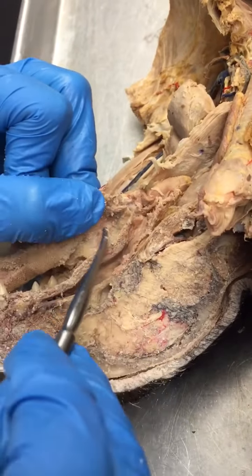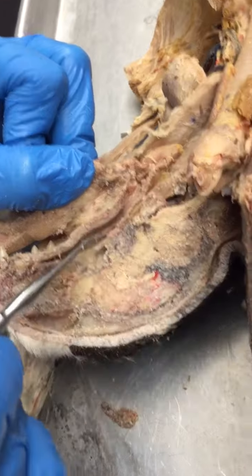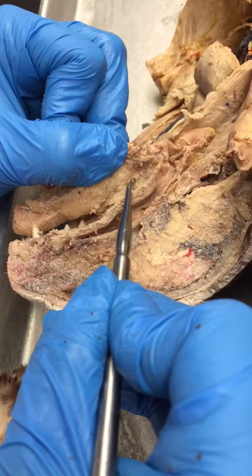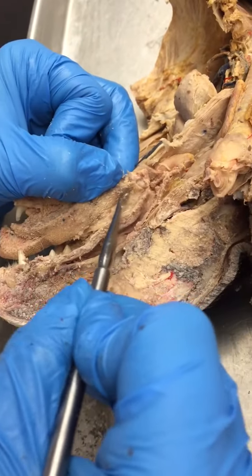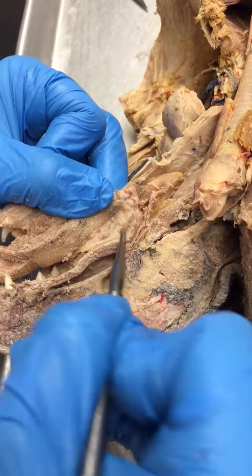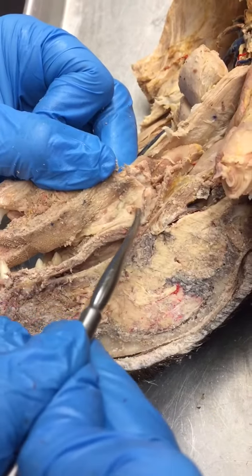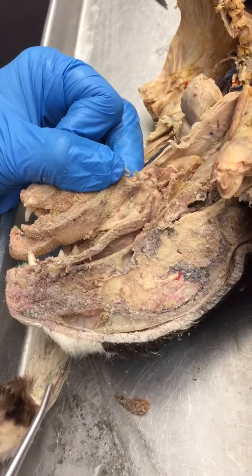Farther back you're going to have your oral pharynx. When we find that opening to the auditory tube, I usually go into the oral cavity kind of in line with that, and then go posterior just ever so slightly so that I can find the palatine tonsil, which is that little finger-like bump right there. It's very small, but that's the cat's palatine tonsil.